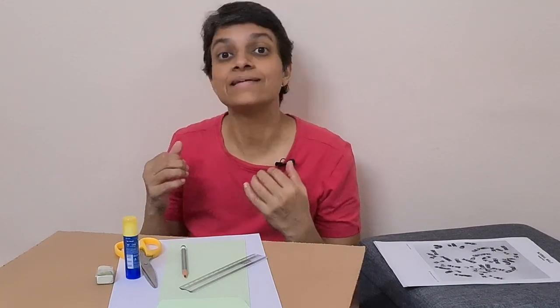Welcome to a laboratory session on human chromosomal analysis using karyotyping. I will be bilingual for the benefit of the local students. Karyotyping is the systematic arrangement of chromosomes in their descending order of sizes. The largest chromosome is arranged at the top and the smallest chromosome is arranged right at the end.